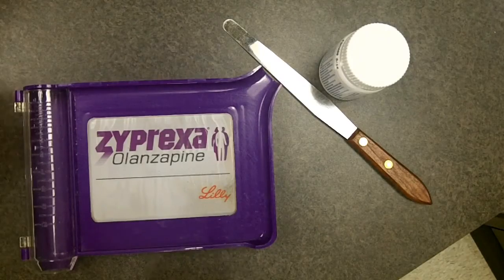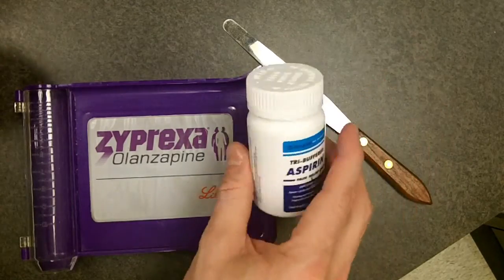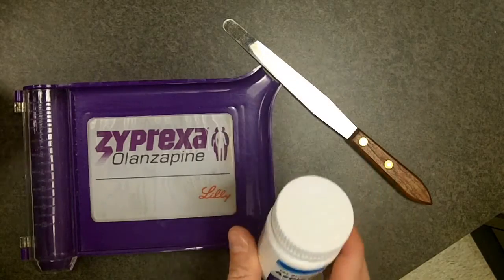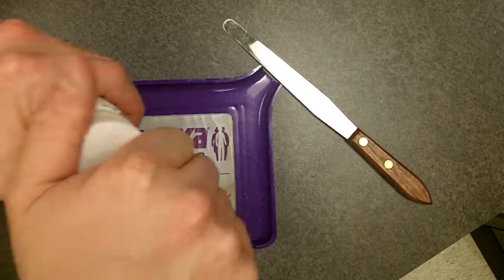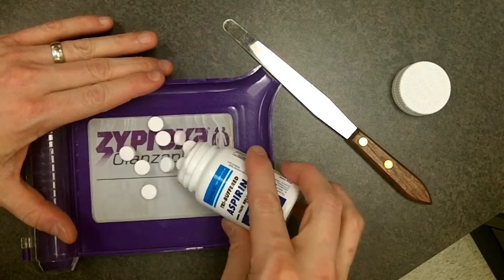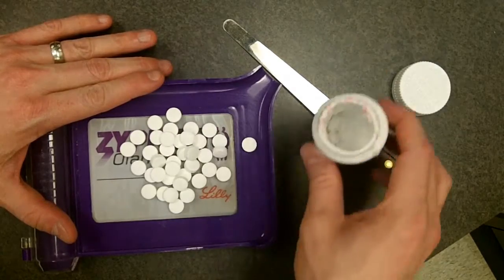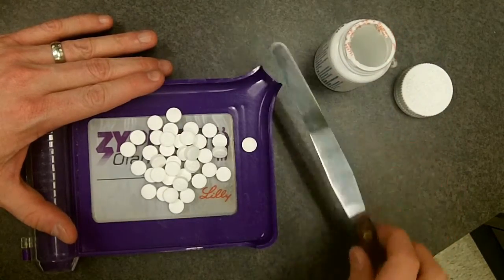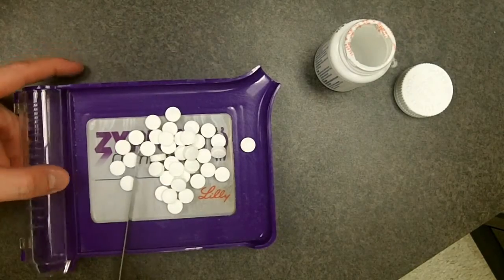We'll start with something rather simple — let's just count out 30 aspirin. You'll use the counting tray and pour what you think is about 30 tablets right there. From this point you can count by fives.